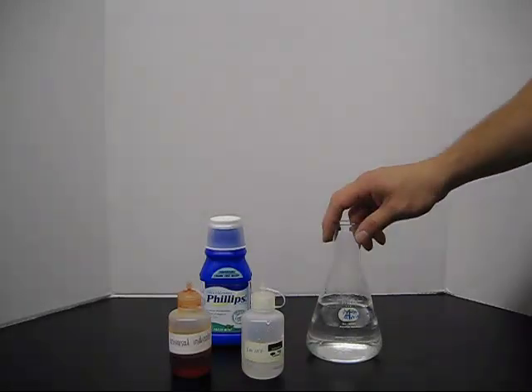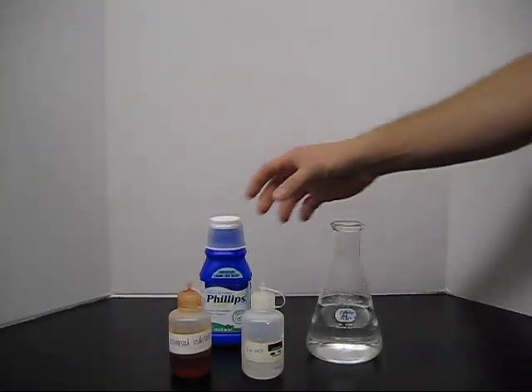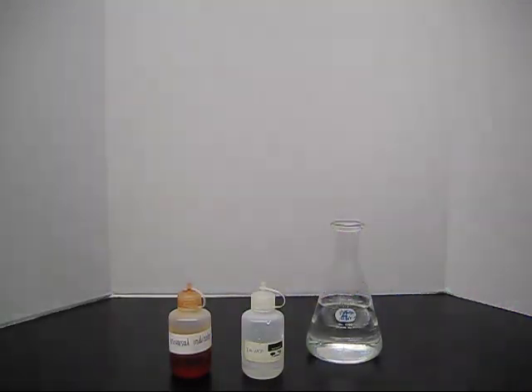Okay, for this demo we have a beaker of cold water. Cold helps slow down the reactions as well as helps with the solubility of the milk of magnesia.